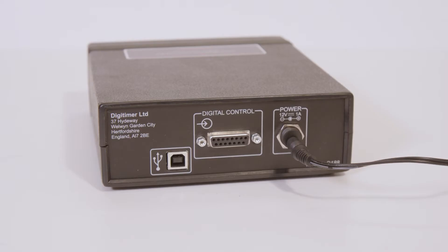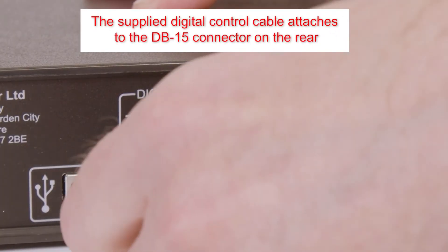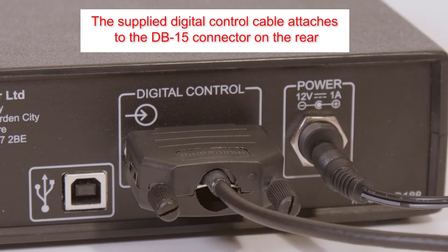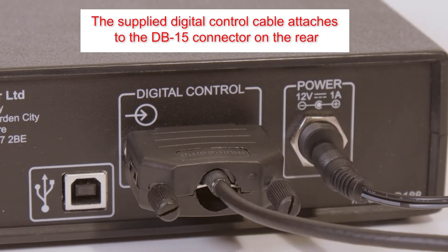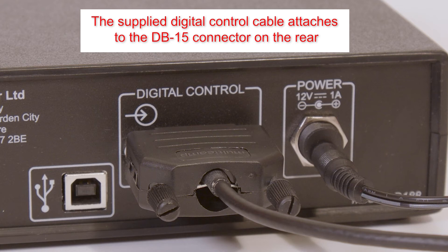The D188 is supplied with a digital control cable fitted with a DB15 plug at one end and tinned wires at the other for connection to digital control sources. If this cable is being used, connect the DB15 plug to the socket on the rear panel.